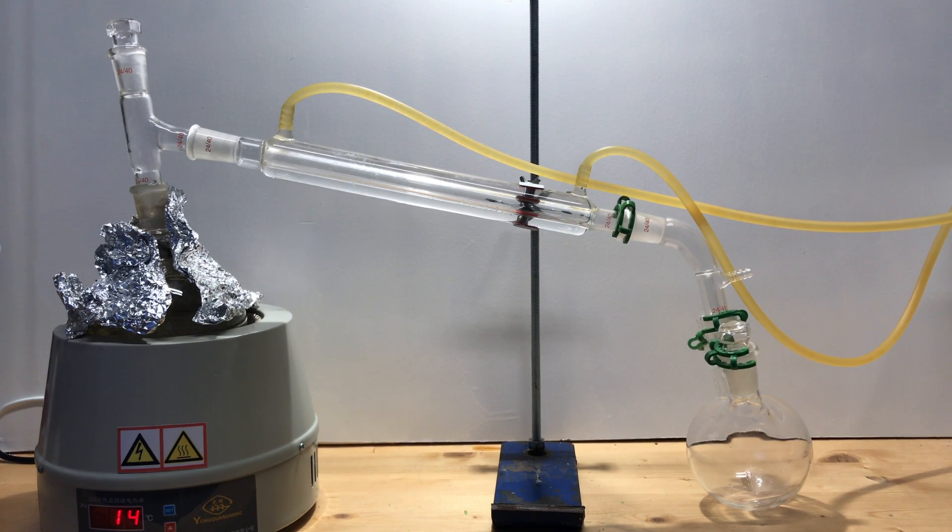I rearranged everything and redid the distillation. In fact, you can see that the green rings have disappeared.